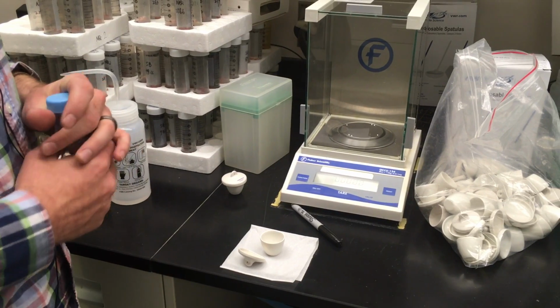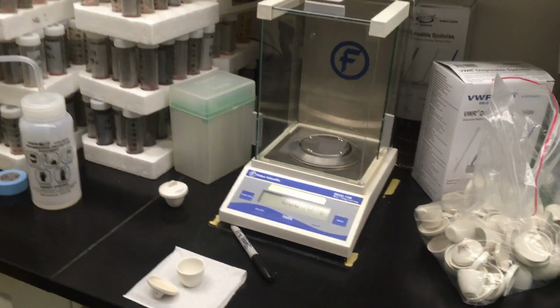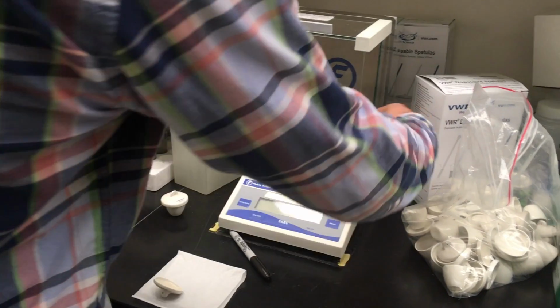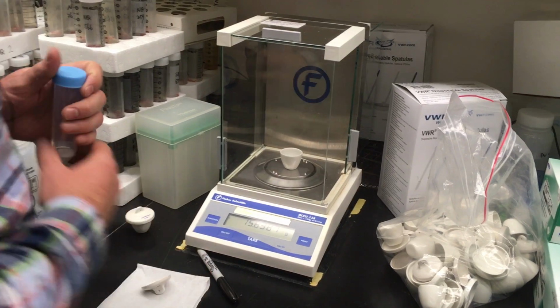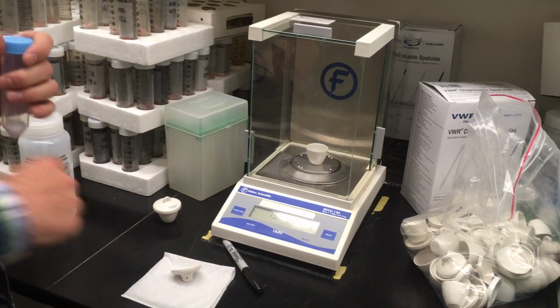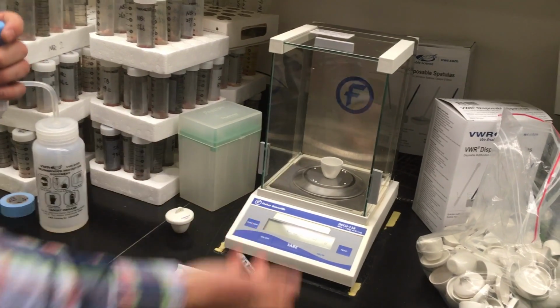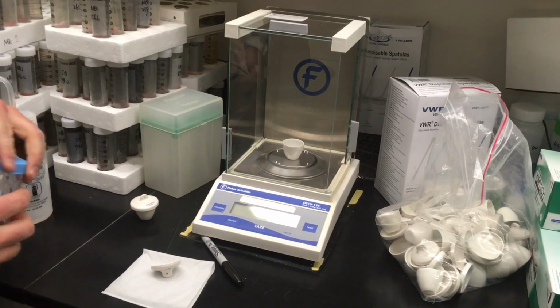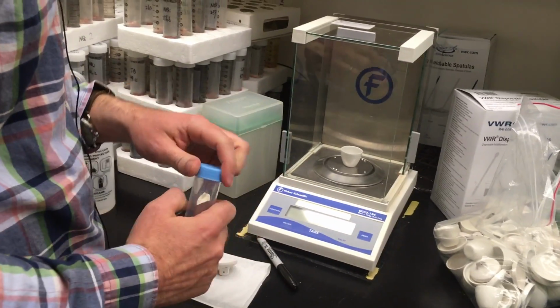And it's actually really important when you do this that you want to measure how much sample you're putting in your crucible. This is something you're going to want to not only just look at, you're going to want to write this down in your notebook. You're going to need this when you actually get your data off of the machine or whatever you're going to do with it. And so one way to do this here is we don't necessarily care about the weight of the crucible. I only want to know the weight of the sample. So I'll zero the weight of the crucible. So any sample I add will register on the weight on the scale there, and it won't worry about the weight of the crucible. So here, let's just pretend we want 20 milligrams of salt.